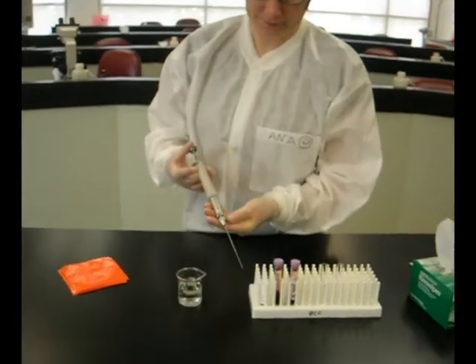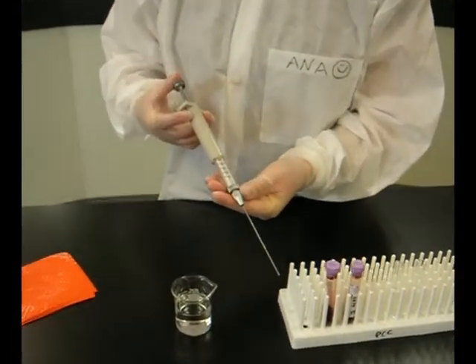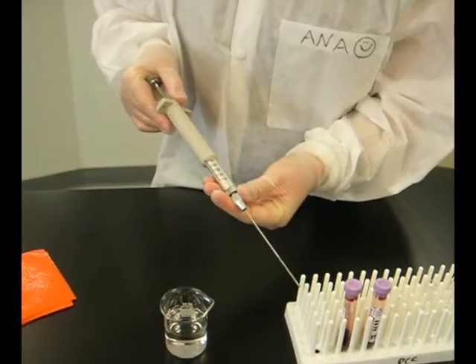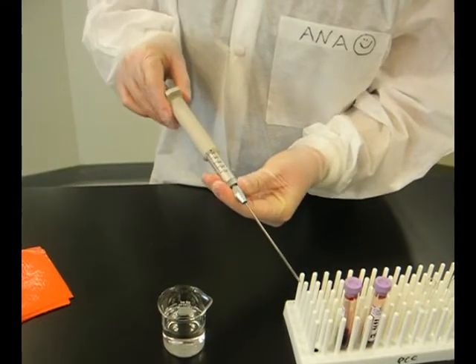First, inspect the micropipette to make sure it is clean and not damaged. Verify that the micropipette is calibrated.